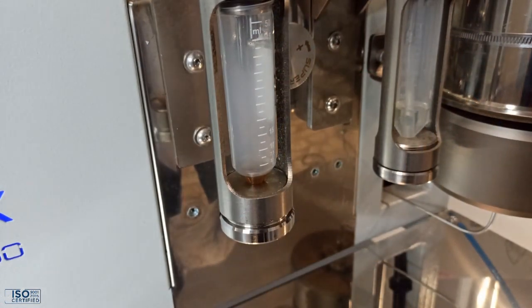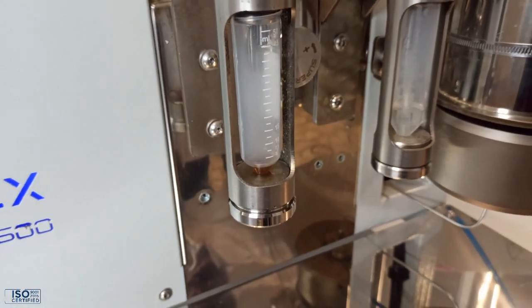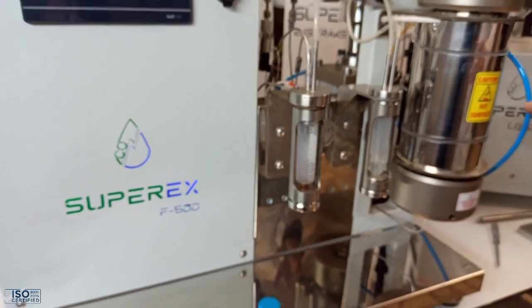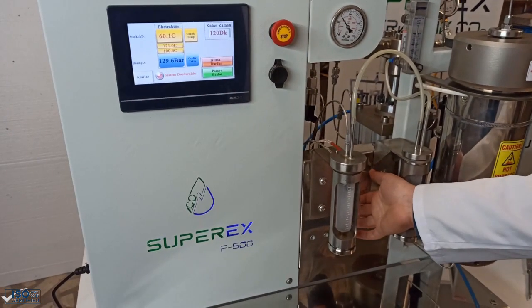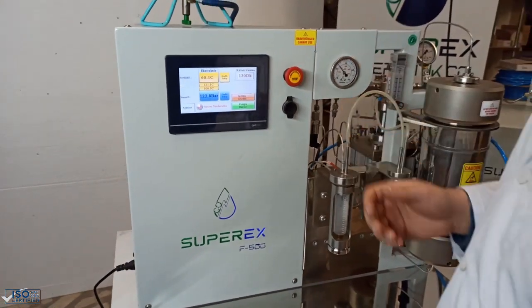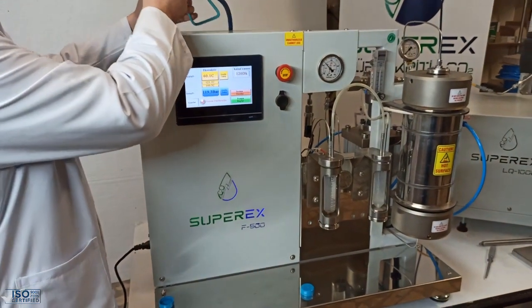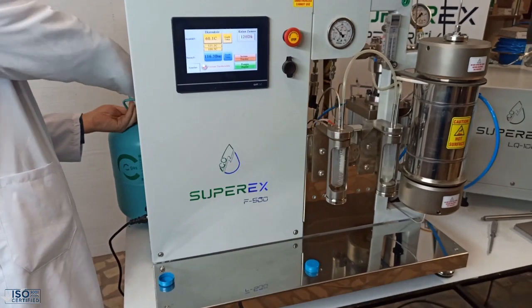The process is done. We stop the pump and the pressure starts to decrease. I open the restriction valve, then close the R134a bottle valve.